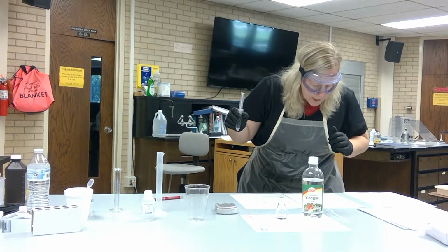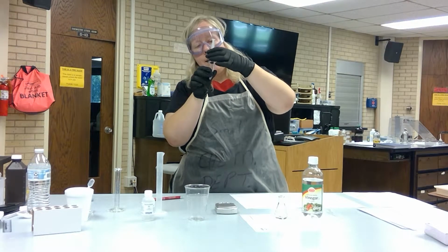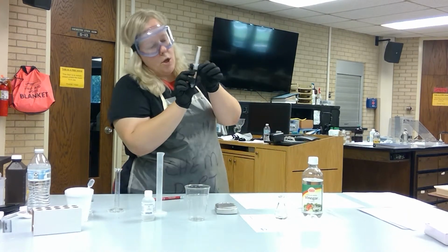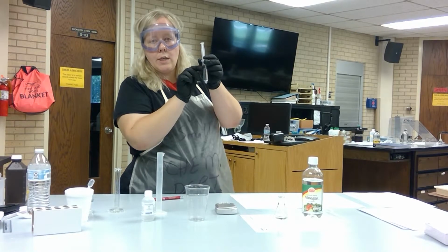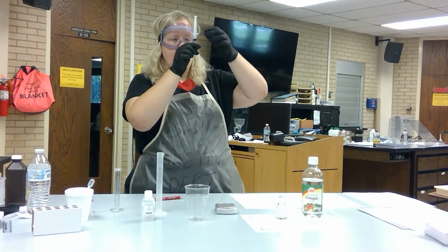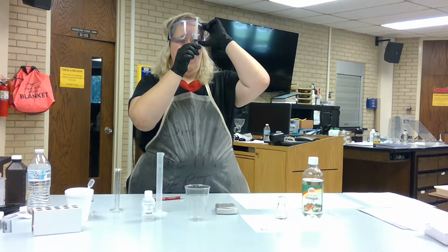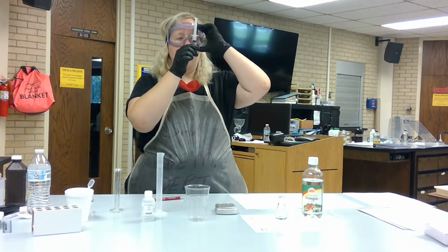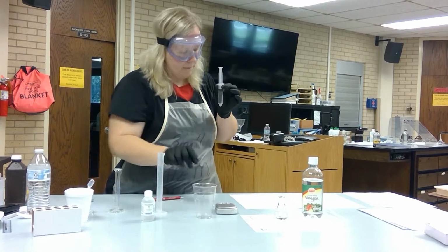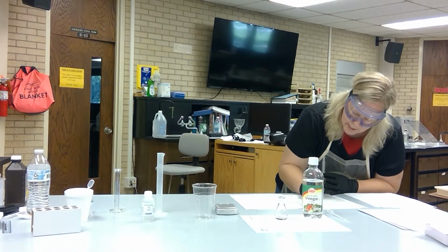All right, so next thing that we're going to need to do is record the initial volume of the syringe. Sorry guys, it's starting to get a little fuzzy in here. Your initial volume is where that plunger is sitting initially. Remember, this is a 10 milliliter syringe. You want to read where that plunger is. So what volume marking does it occur at? And after dislodging the air, you may not be right at 10. Okay, so looks like I'm sitting right at that 9 milliliter line. So I've lost about 1 milliliter, and that accounts for the volume there. So my initial volume, I'm going to go on to data table 1, and I'm going to fill in the 9 milliliter line.